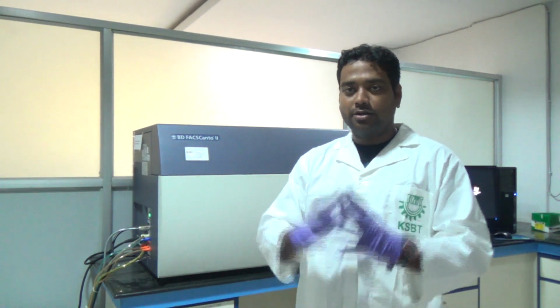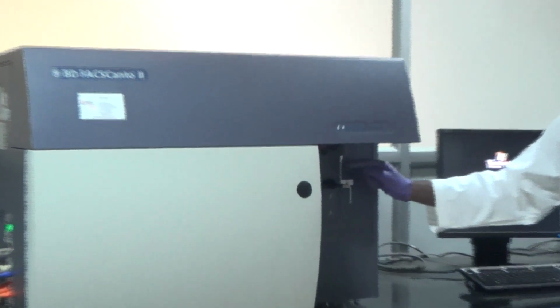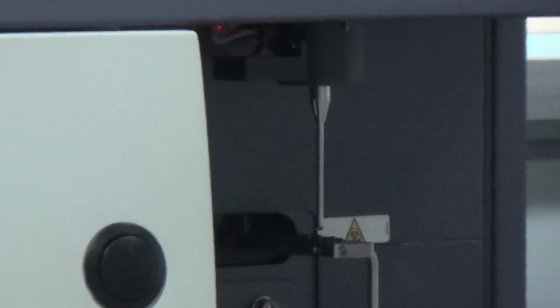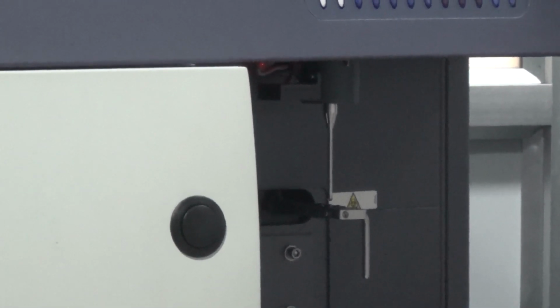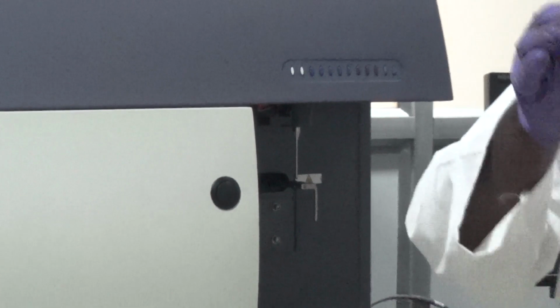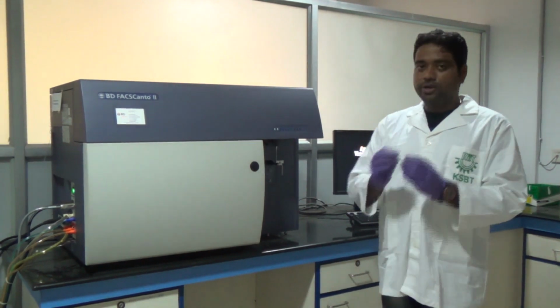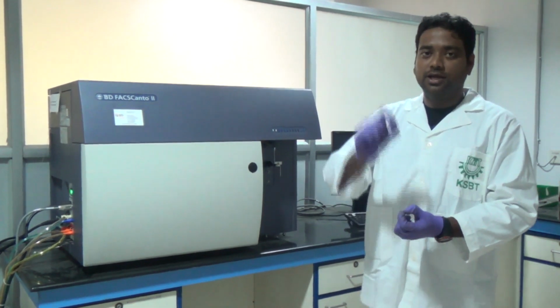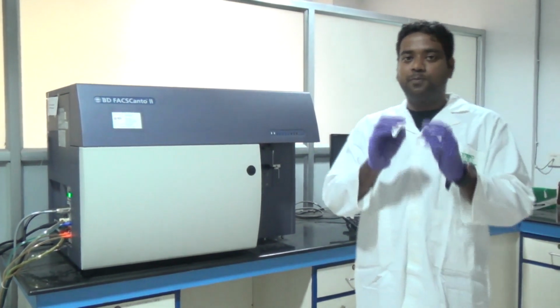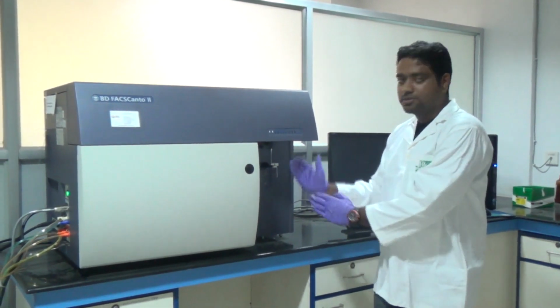So before going to the software, as I am telling this optics part, there is one more very important aspect with this instrument, and that is the nozzle. So what is this nozzle? This is a solid bar here. This nozzle can take only one cell at a time to pass through. So this is a very sensitive instrument. We need to dilute our sample so that in a single run single cells pass, so there will be perfect counting of those cells, because we can control this flow also.